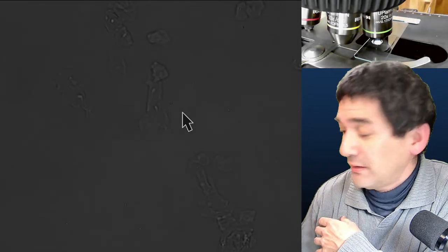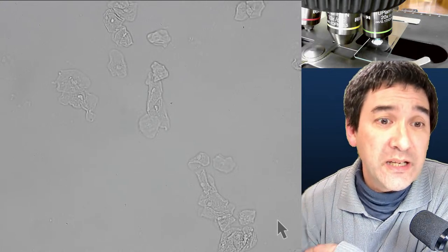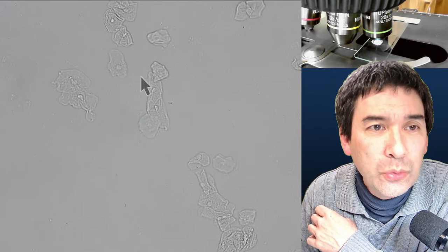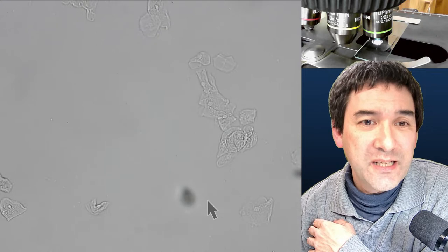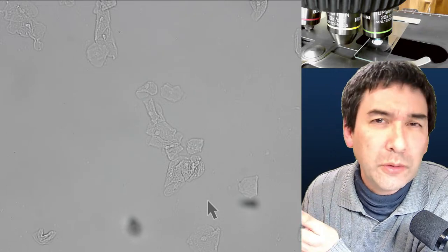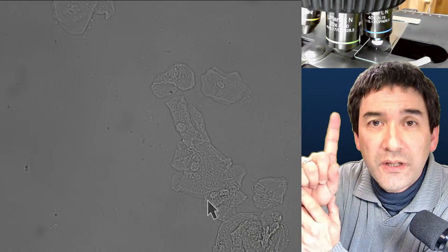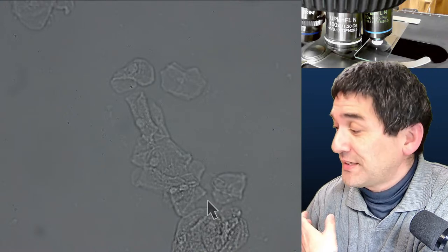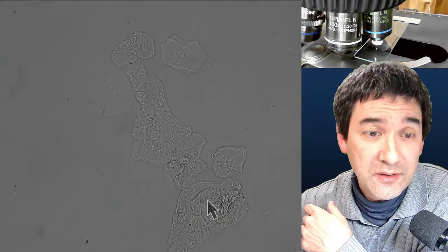You can just barely make out some cells and their nuclei — those round things inside — but it's not satisfying. Normally you'd stain them, but that kills the cells. Now I switch to my phase contrast 40x objective. Without engaging the phase contrast condenser it looks the same as bright field — because I haven't activated the phase contrast annulus yet.